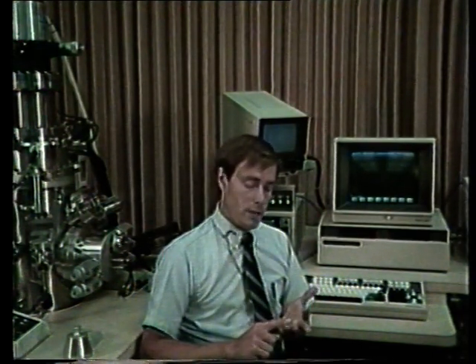Let's briefly review what we have accomplished so far. First, we introduced a sample into the specimen chamber. We then obtained a TV image. Using the TV image as a guide, we located the sample and an area on the sample where we wanted to do the analysis. We then positioned the sample at the focal point of the analyzer. We chose a beam voltage at which to analyze the sample. We then optimized the electron gun parameters in order to obtain the best SEM image. Once we achieved those parameters, we documented the area where we will do analysis by taking SEM photos.